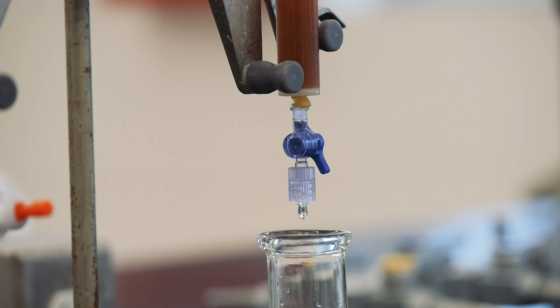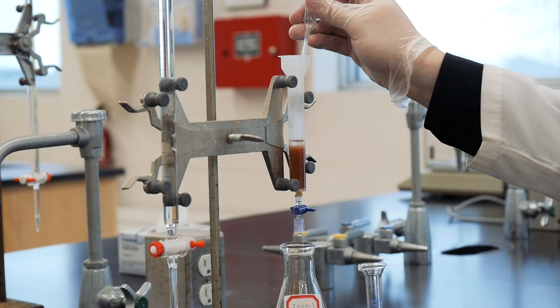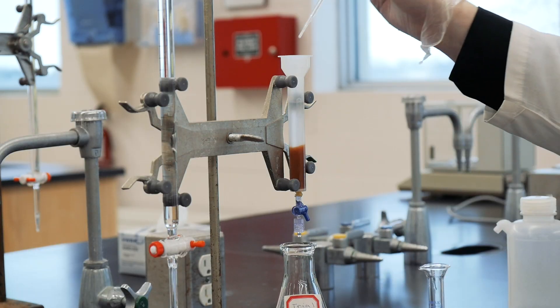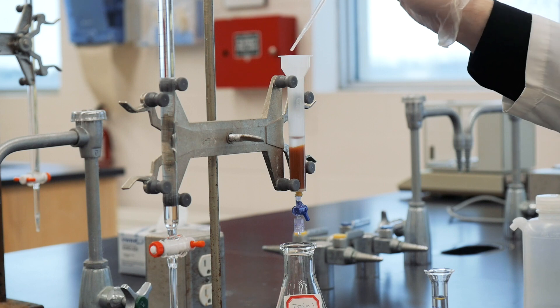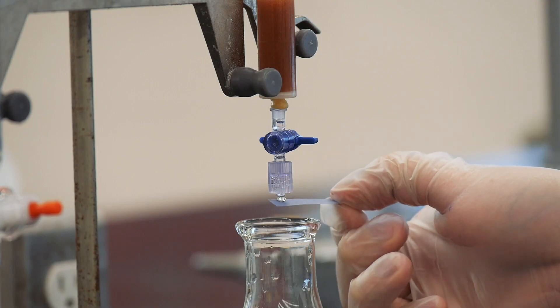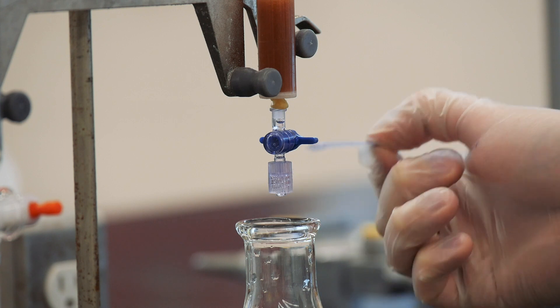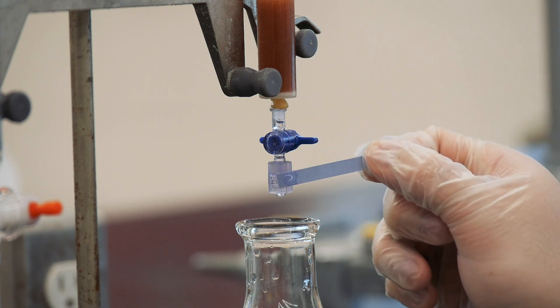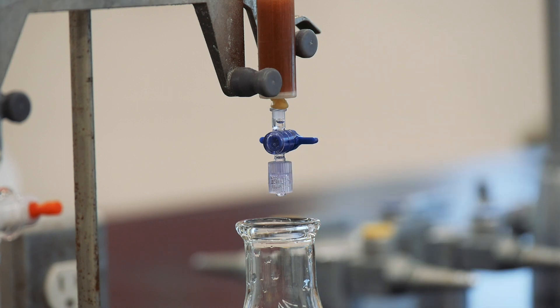After that, you'll just need to wash out any remaining unbound ions, so collect three washes of about 10 mils each of deionized water in your Erlenmeyer flask. Check the last drop of the third wash with the blue litmus paper. If the paper remains blue, you're good to go to proceed to the next step. Otherwise, you'll need to wash with another 10 mils.